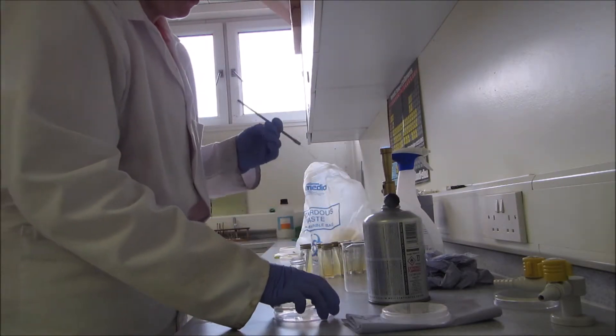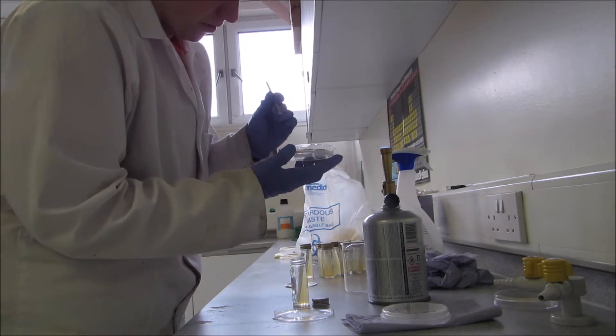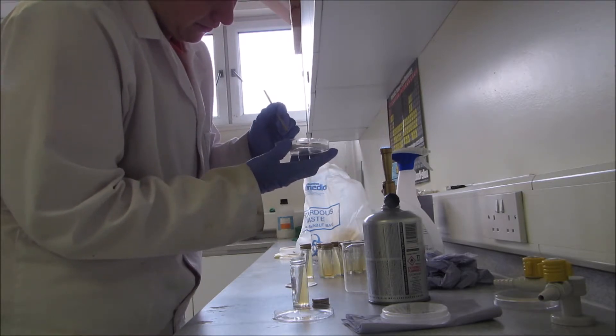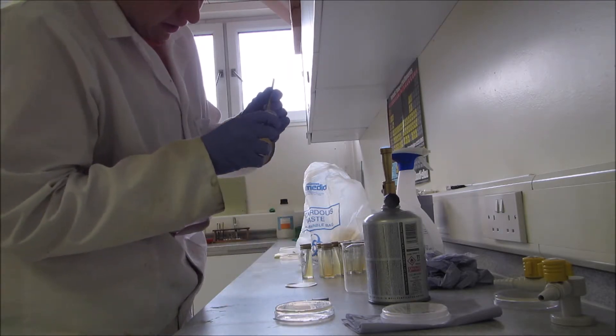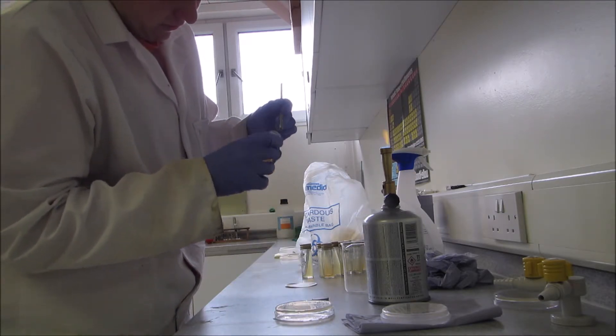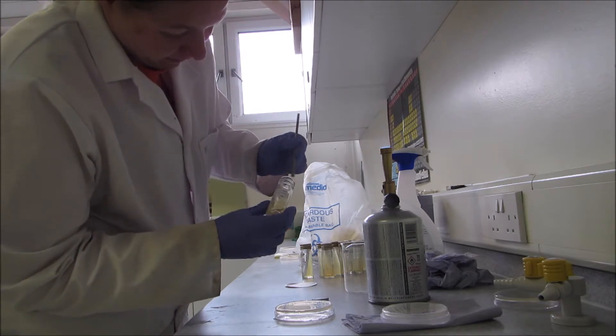And this time you're going for maximum growth. You don't want single colonies, so I'll lift another colony and I'll just spread it all over. So I go up and down, side to side.